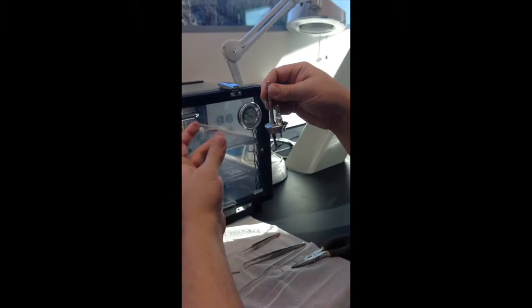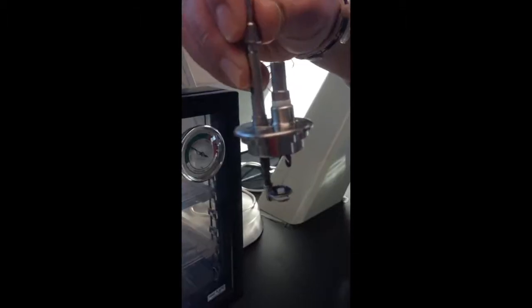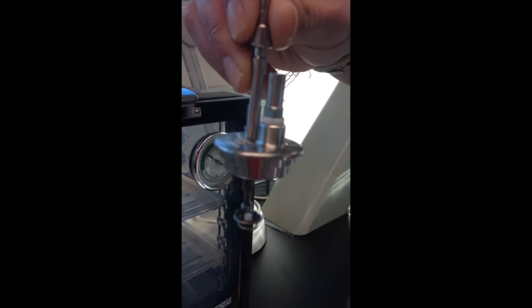It's not sitting on top, but it's on there. When you have a sample, it might break if standing up. The best samples hold together well, and if it does, you can put it on its side. Always give it a little shake, because when you're putting the lid on, you still want to be careful since you can't see it. That's usually how you get a misfire — you won't know until after ten minutes, and then you open it up and the sample is sitting in the bottom of the pan.